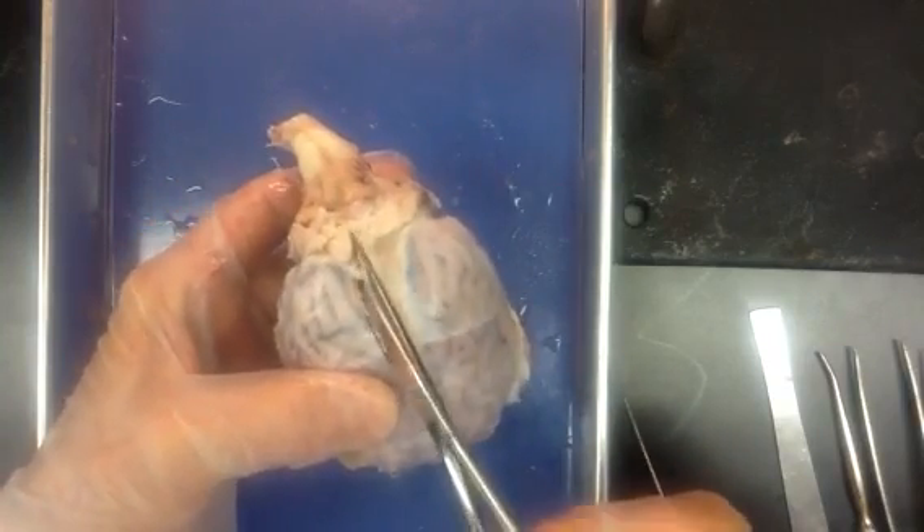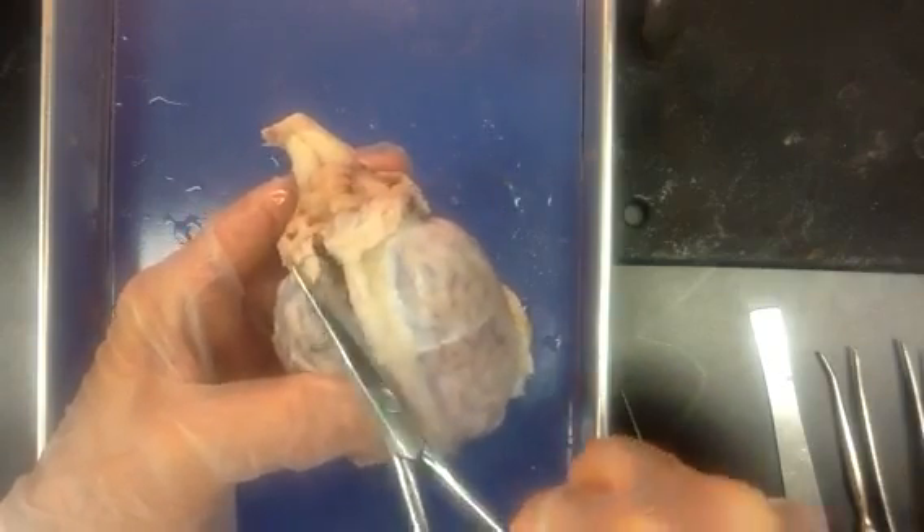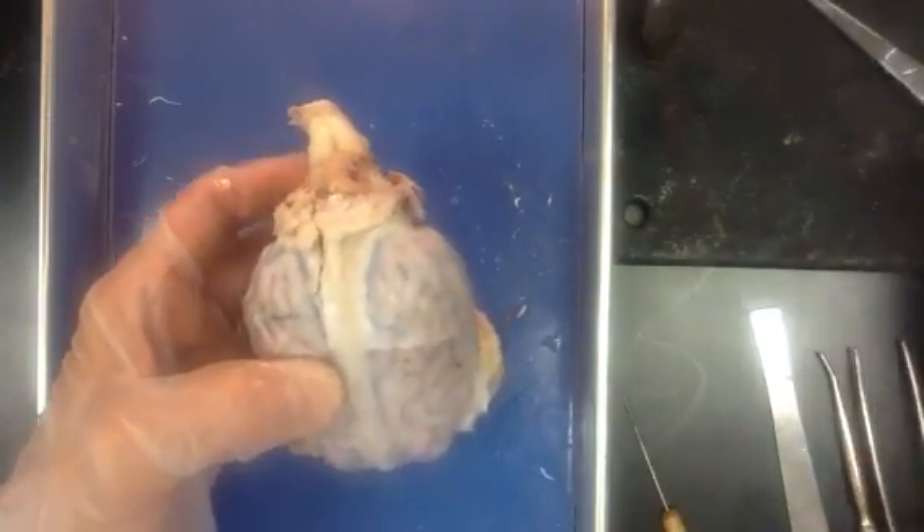It's really tough back here. It actually sometimes may have a little bit of residual bone left from the cranium of the sheep. This one doesn't seem to, but you could have a real heck of a time doing that.